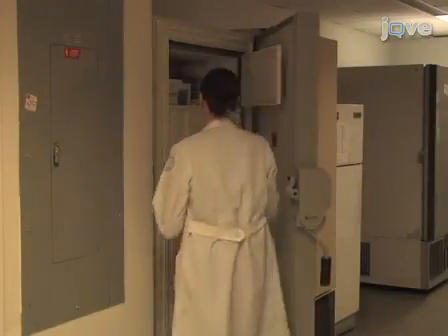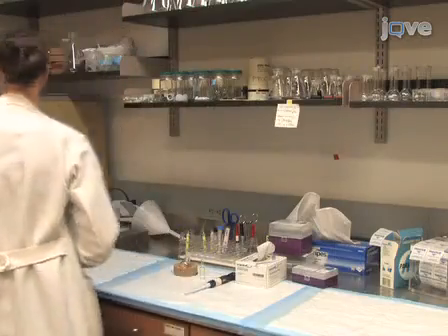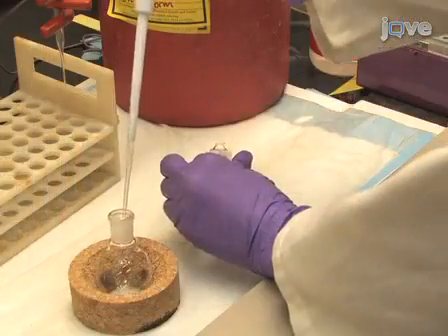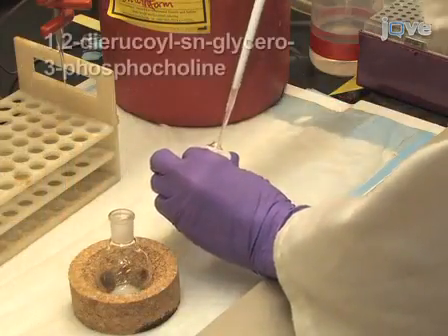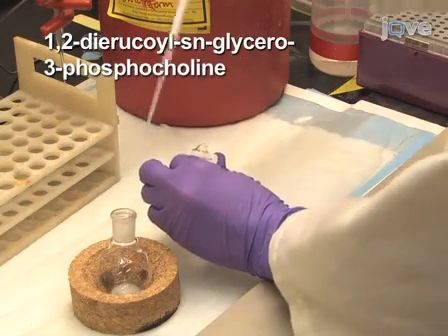On day 1 of this procedure, remove the lipid from the freezer and let it equilibrate to room temperature. Once equilibrated, add 0.6 ml of 25 mg per milliliter lipid in chloroform solution to a 25 ml round bottom flask.